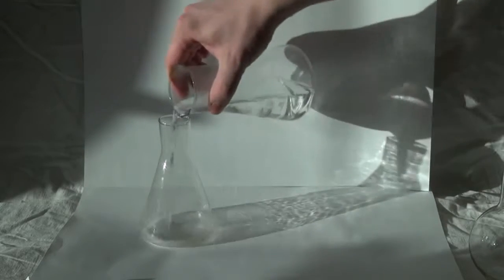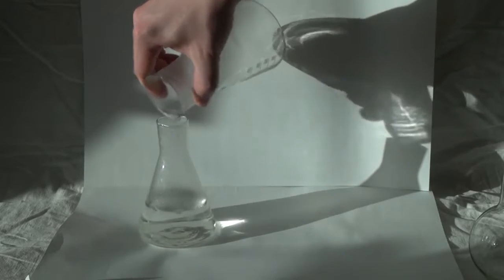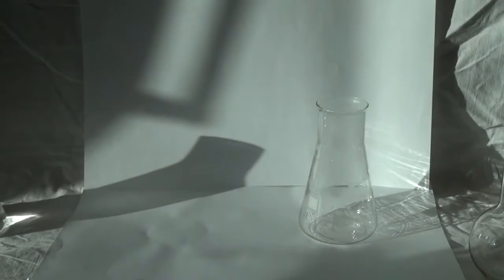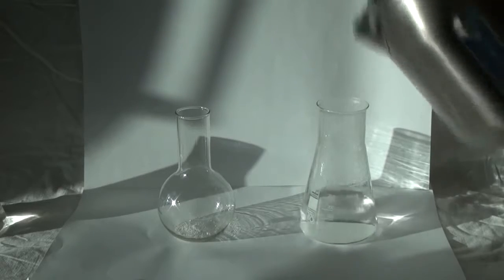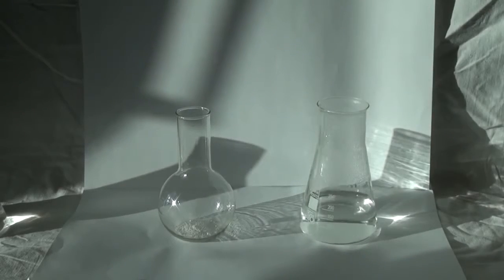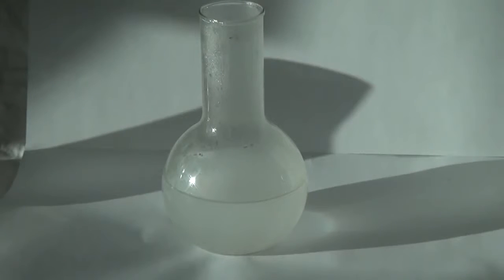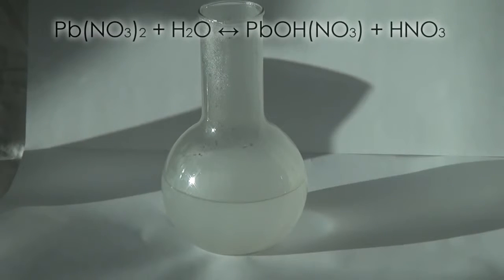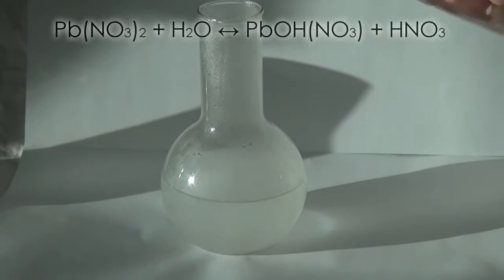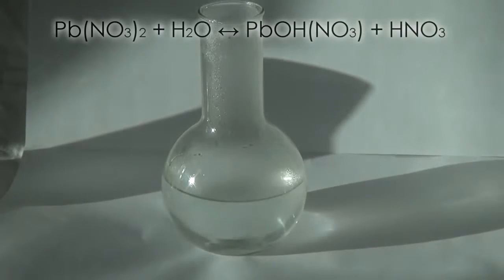The water should be really hot. If the water is colder, the experiment may fail. Potassium iodide dissolves well, and the lead nitrate solution becomes cloudy. This is due to a process called hydrolysis. To prevent it, add a little of acetic acid to the solution.